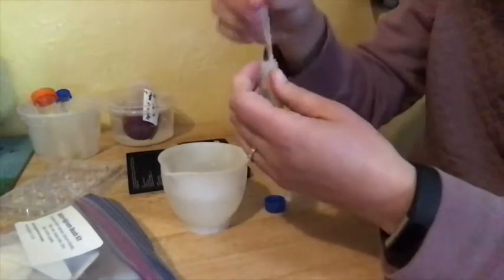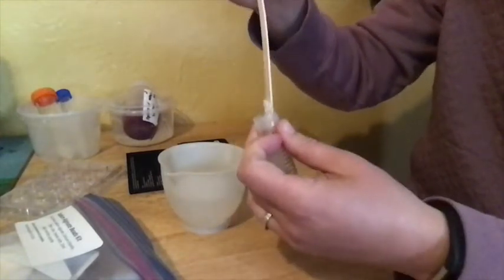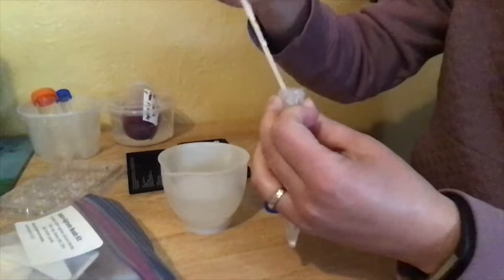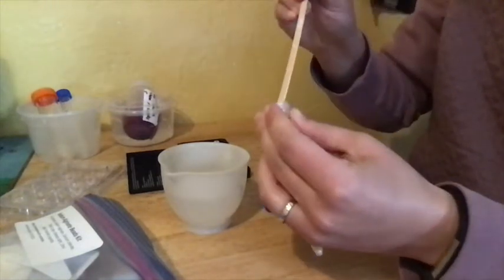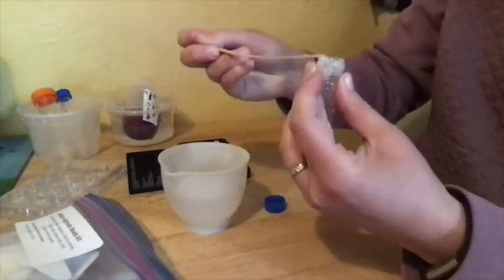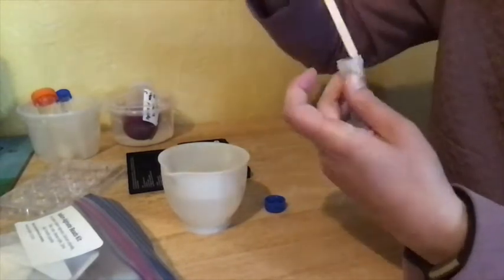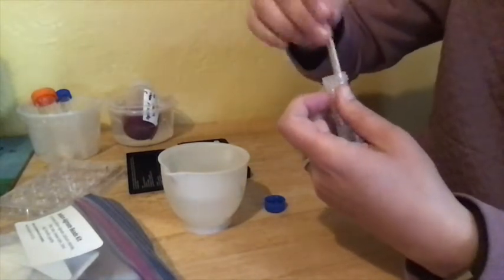And you're going to continue to mix thoroughly, scraping down. If you get clumps of stuff on here, make sure you scrape that off on the sides and then mix it back in. Mine's pretty lumpy, so you just got to keep mixing. Try different mixing tools, try not to spill. Break up the clumps.